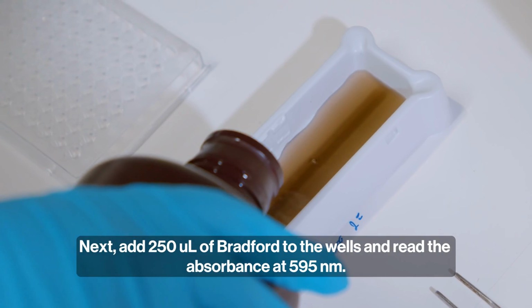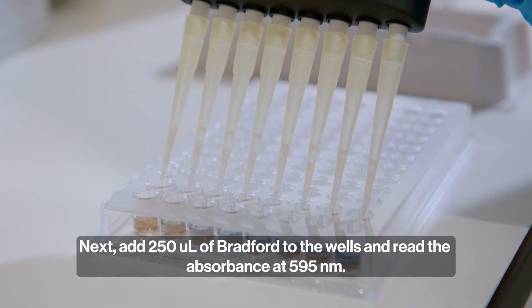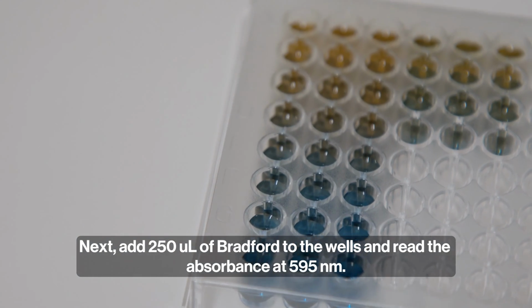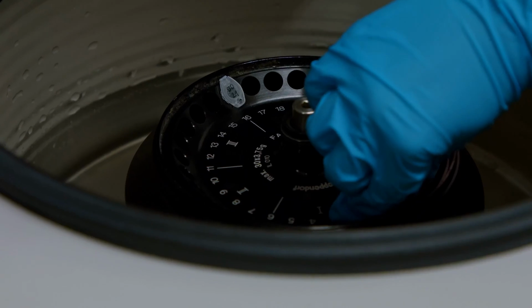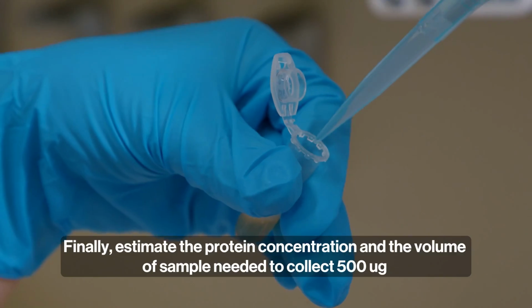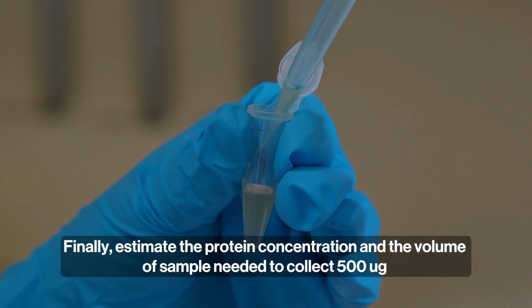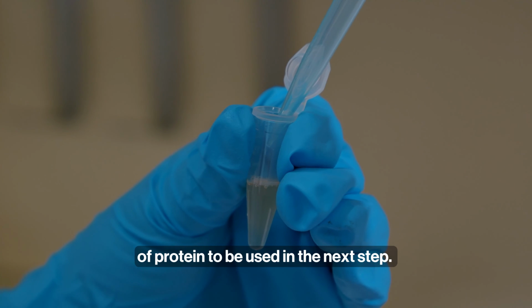Next, add 250 microliters of Bradford to the wells and read the absorbance at 595 nanometers. Finally, estimate the protein concentration and the volume of sample needed to collect 500 micrograms of protein to be used in the next step.